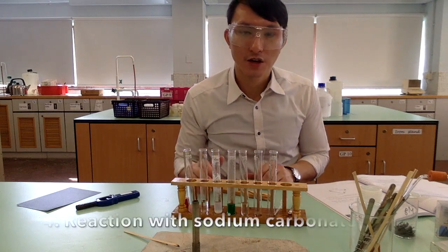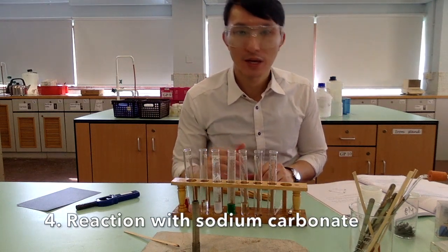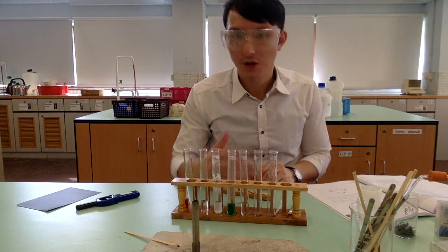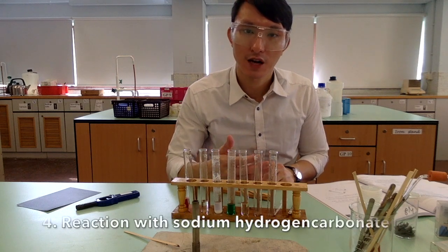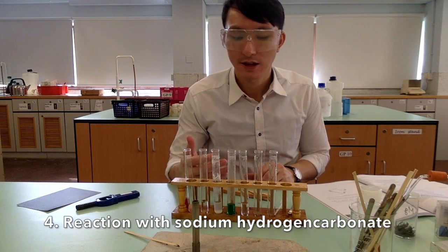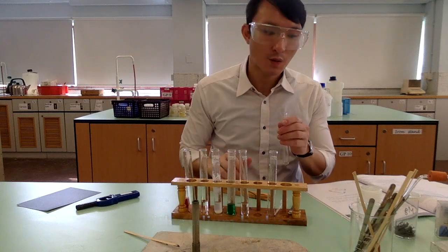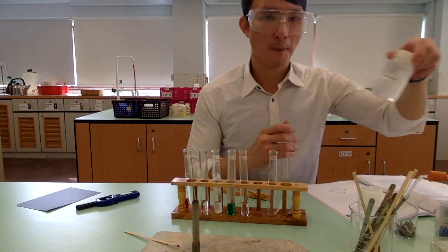So for the fourth reaction, we are trying to study the reaction between carbonate and hydrochloric acid. Also, the reaction between hydrogen carbonate and acid. So first of all, we are going to use a test tube, and to that we are going to add lime water. Okay?